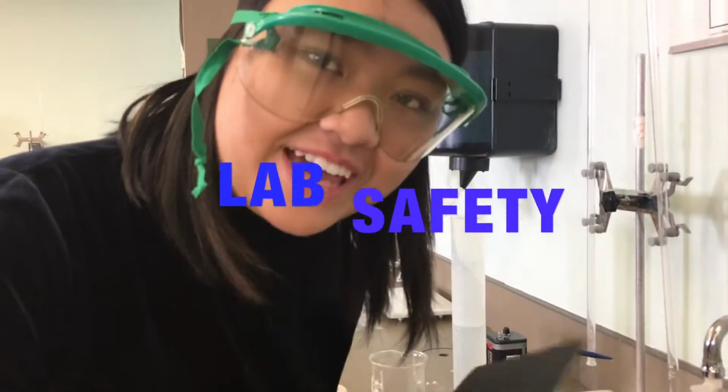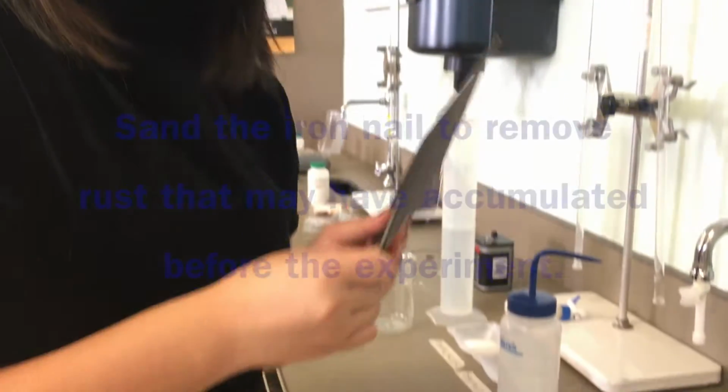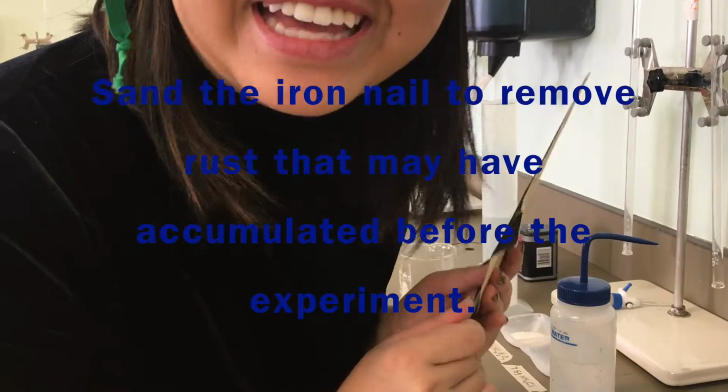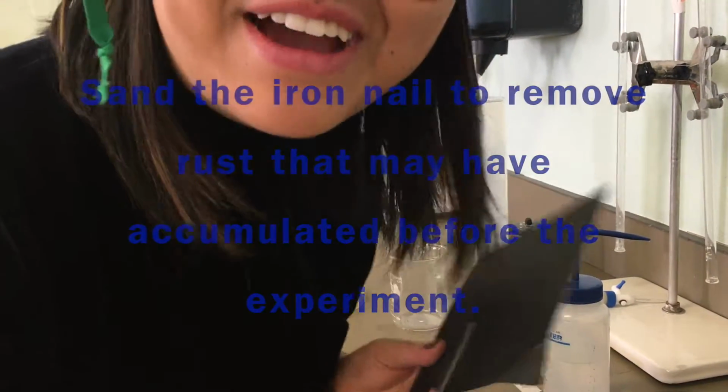Always wear your chem goggles to be safe. Even if they're super blurry and you can't see out of them, still wear them.